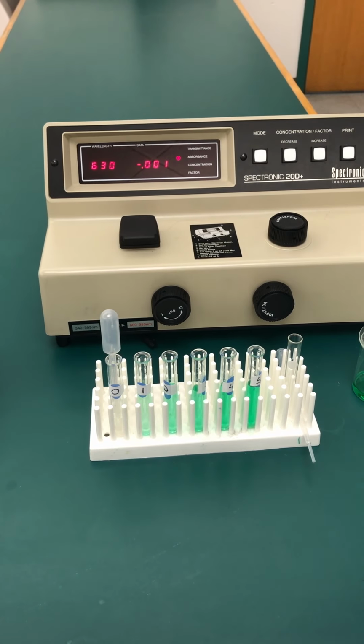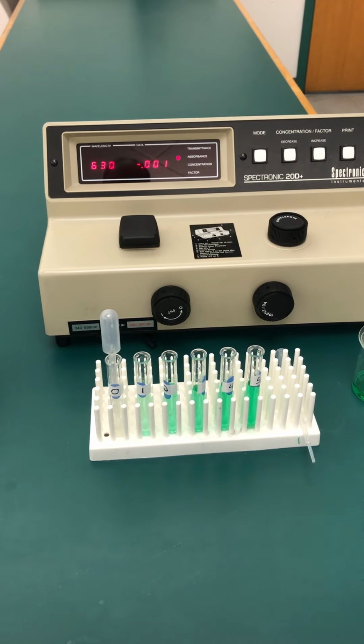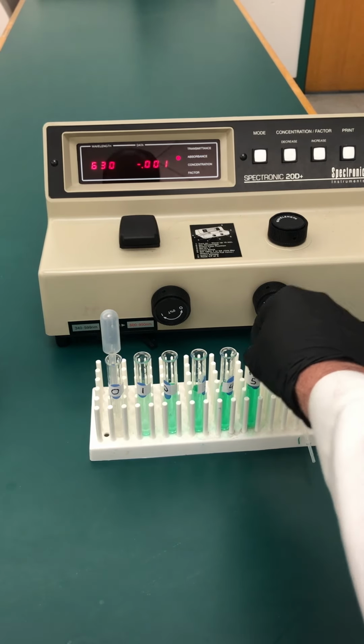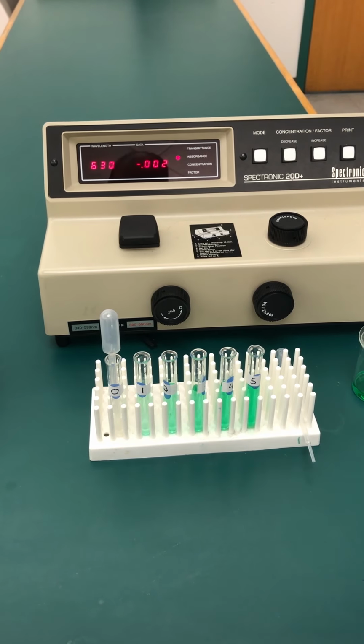Okay. Now, in our test cuvette, we're going to put in the solutions that we made of viridis. As you can tell, they go from more dilute to more concentrated, and test tube 5 is actually the test solution itself, which we have measured. So it'll be interesting to see how close the measurement comes to the one that we did before. It might be the same, it might be a little different. It depends on whether you use the same cuvettes or you did it the same day or whatever, okay?